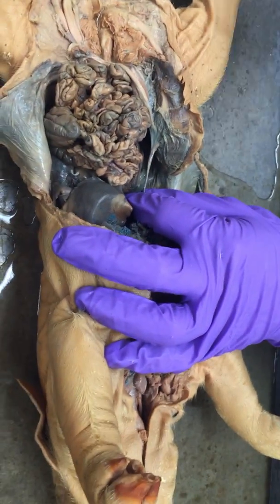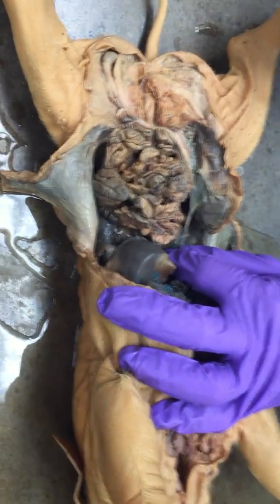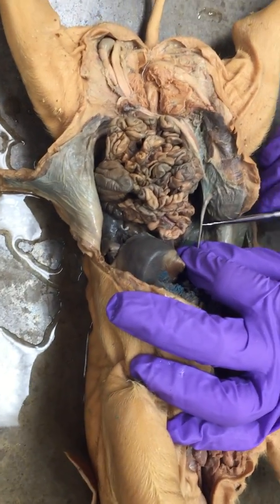to the fetal liver. So that blood bypasses the liver through the ductus venosus. So only fetuses have that? A ductus venosus, yes. Ductus venosus.